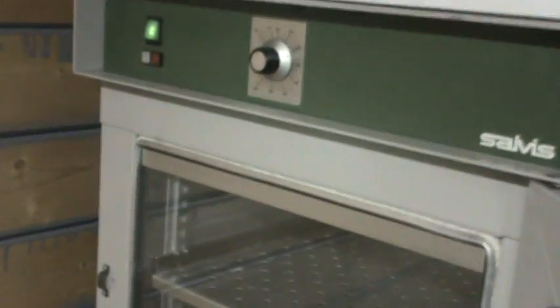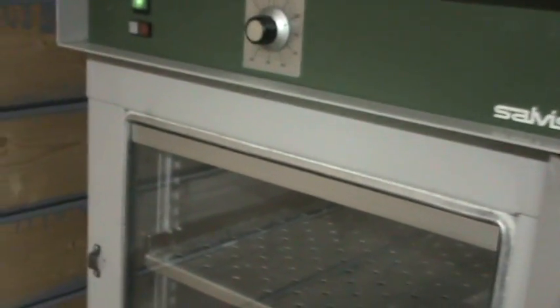Open the door to my stove, which I already set to 37 degrees Celsius. Open the glass door. It's nice and warm in there. I don't know if it already reached. It's now 33 degrees. Just place the slides into the stove like that.